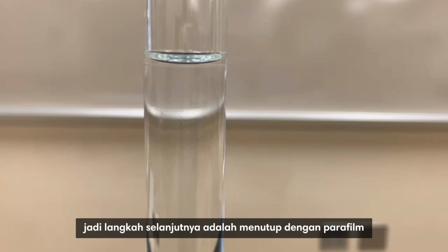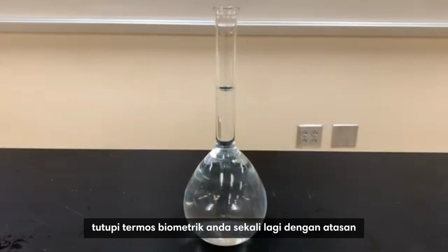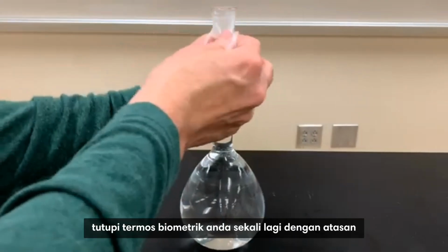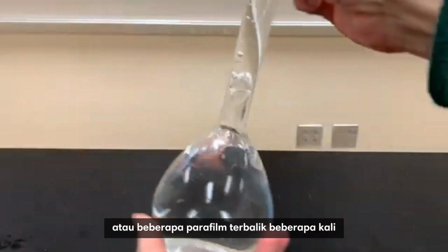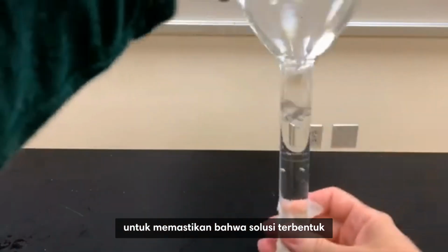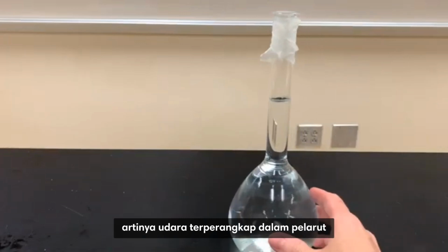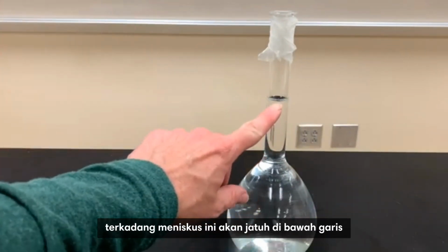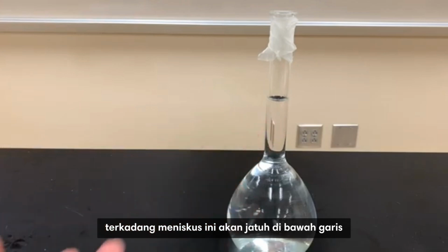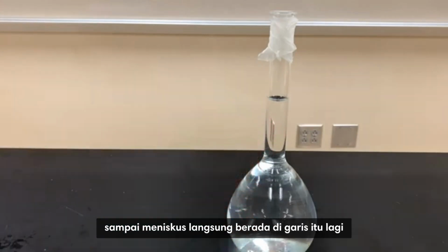So the next step is to cover it with parafilm, mix it, and see if it still remains with the meniscus on that line. Cover your volumetric flask one more time with a top or some parafilm. Invert it a few times to make sure that the solution forms. And if there is a lot of bubbling, meaning air trapped in the solvent and solute, in the solution that's formed, sometimes this meniscus will drop below the line. Then you just add a little bit more water until the meniscus is directly on that line again.